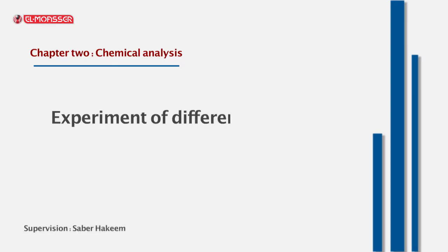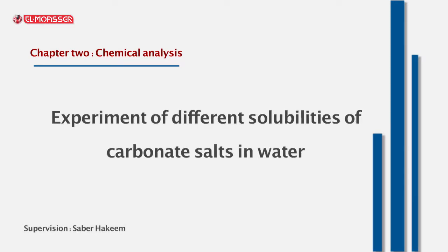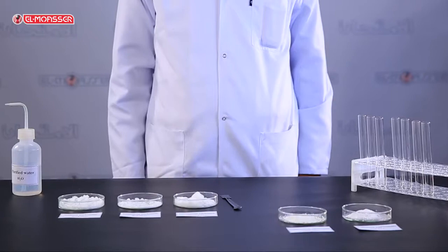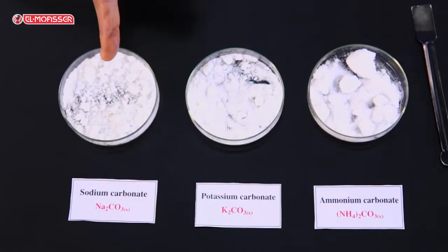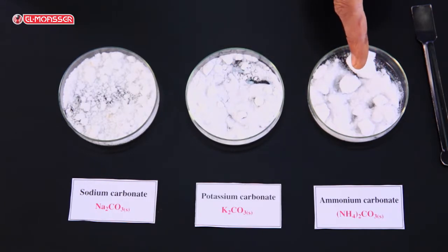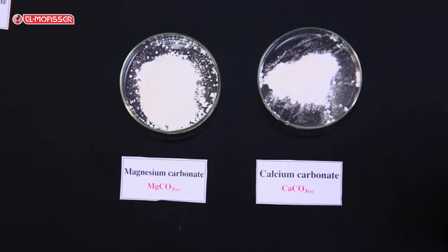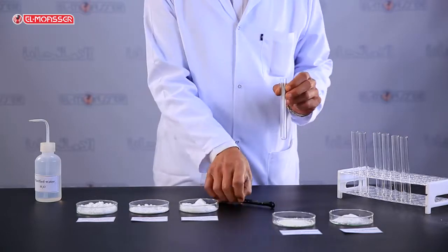In this experiment we test the different solubilities of carbonate salts in water. In front of you are five samples of different carbonate salts: sodium carbonate, potassium carbonate, ammonium carbonate, magnesium carbonate, and calcium carbonate. How can you test their solubility in water?